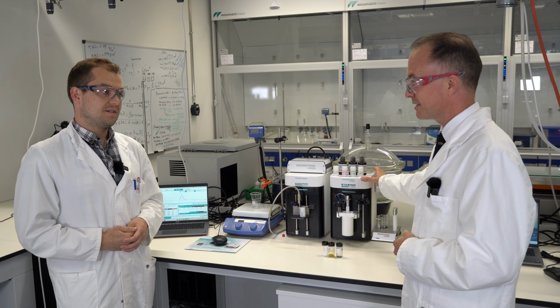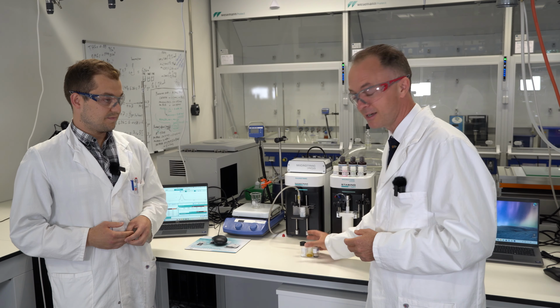Super. So we're very grateful to the University of Luxembourg, through their equipment fund, for supporting the purchase of this equipment. And together it lets us synthesize good materials like these samples that Chris has already made, characterize them, and, like Chris said, use them for good things like membranes for gas separation.